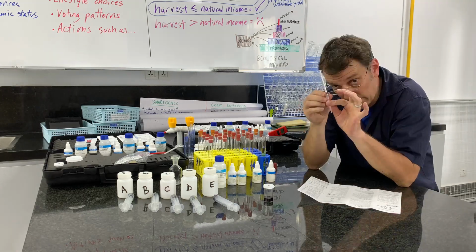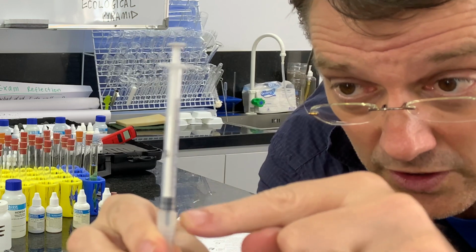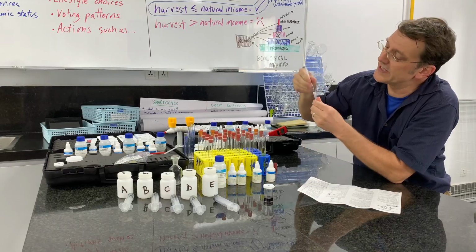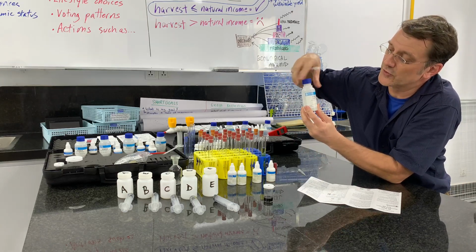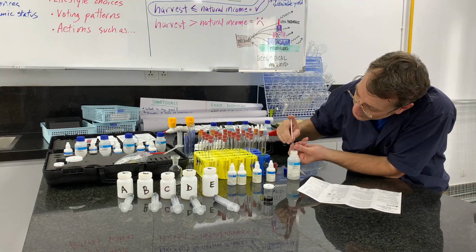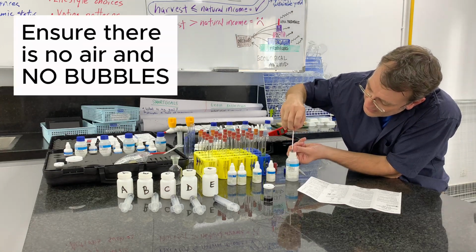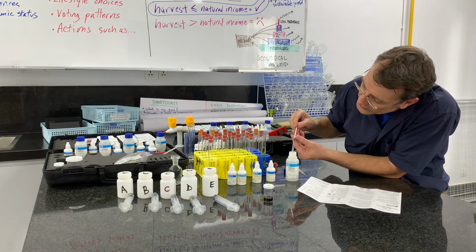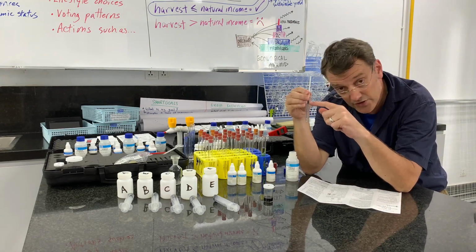Next step, take this little micro syringe. This entire syringe holds only 1 milliliter of solution. Take this syringe, and we're going to pull this dissolved oxygen titrant solution into our little micro syringe. Put it in and pull it all the way up until the plunger is at 0.0, which means I want to make sure that there's no air in this thing at all. So there, I've gone beyond what I need to do. I'm going to move my plunger into position here so that it's very precise. The bottom of my plunger is on the 0 mark.